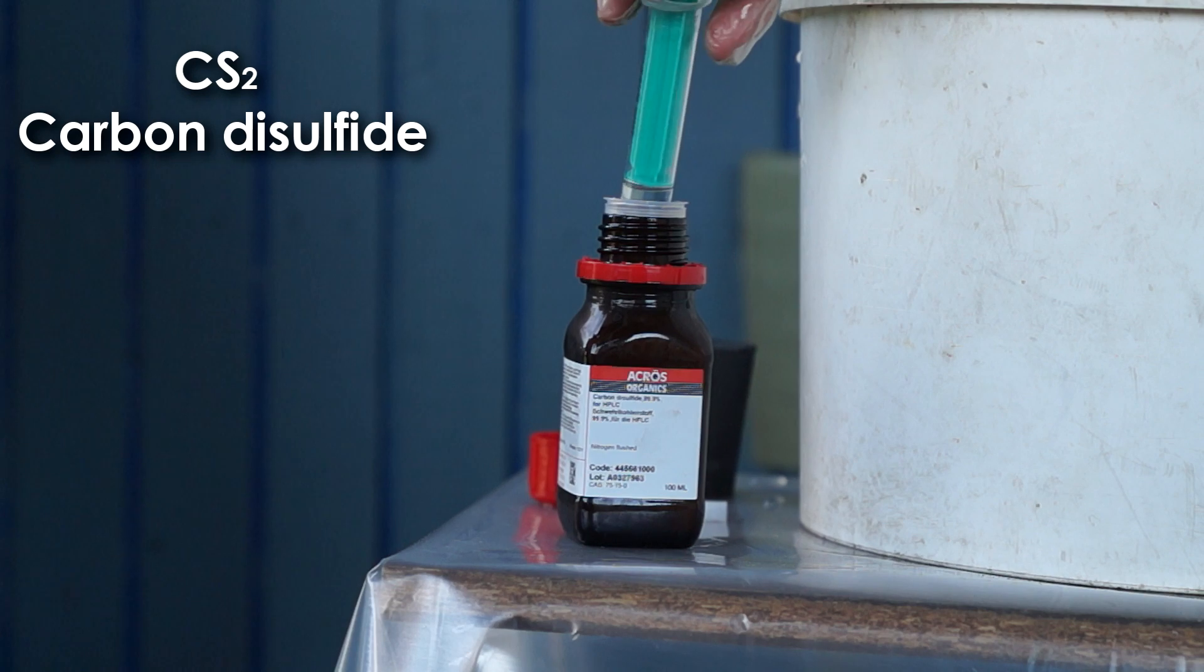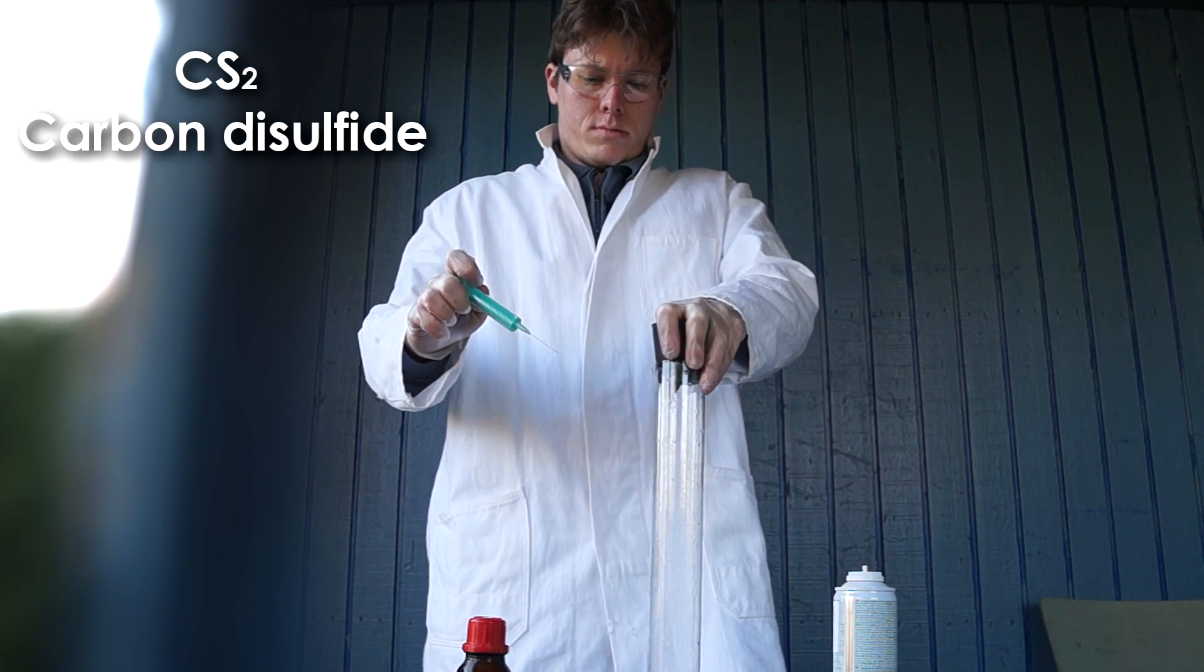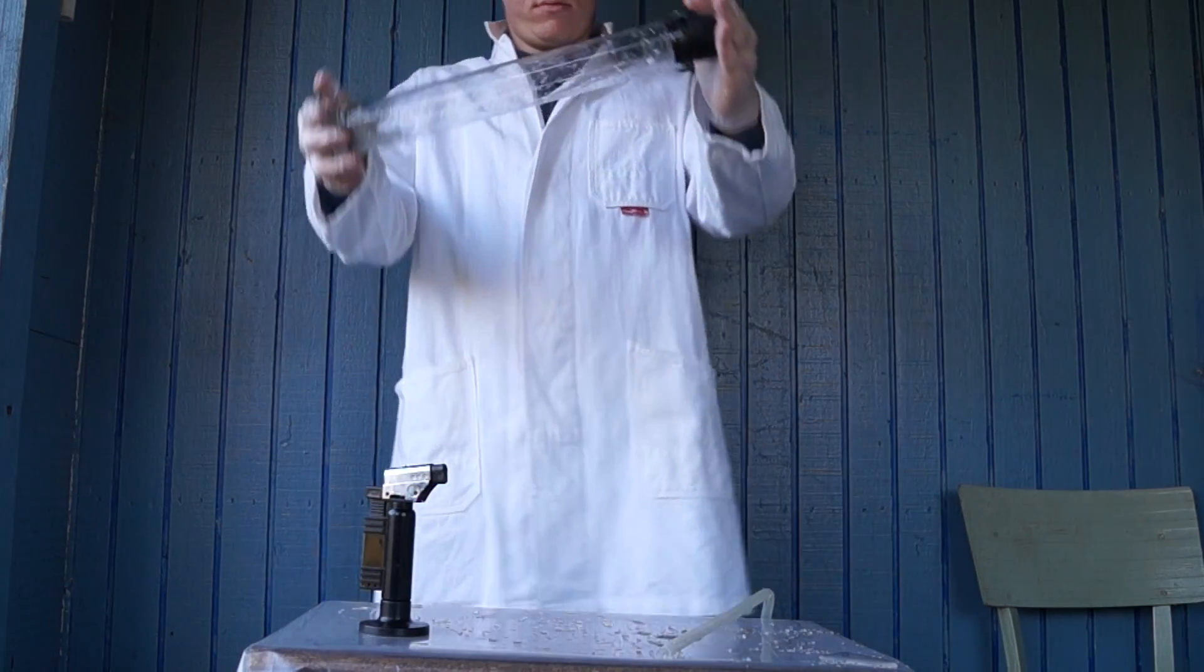We add another component, carbon disulfide. Let's leave the cylinder for 15 minutes to let carbon disulfide evaporate and mix with nitrous oxide.